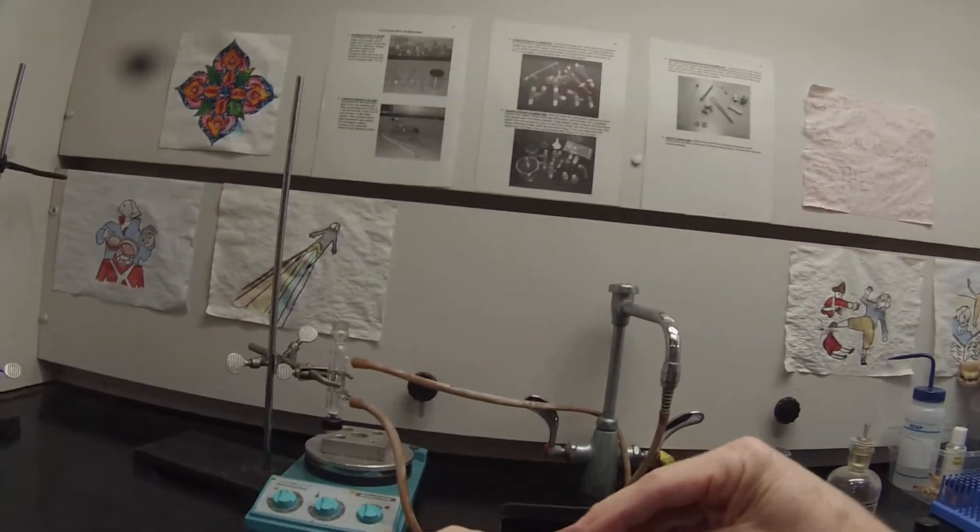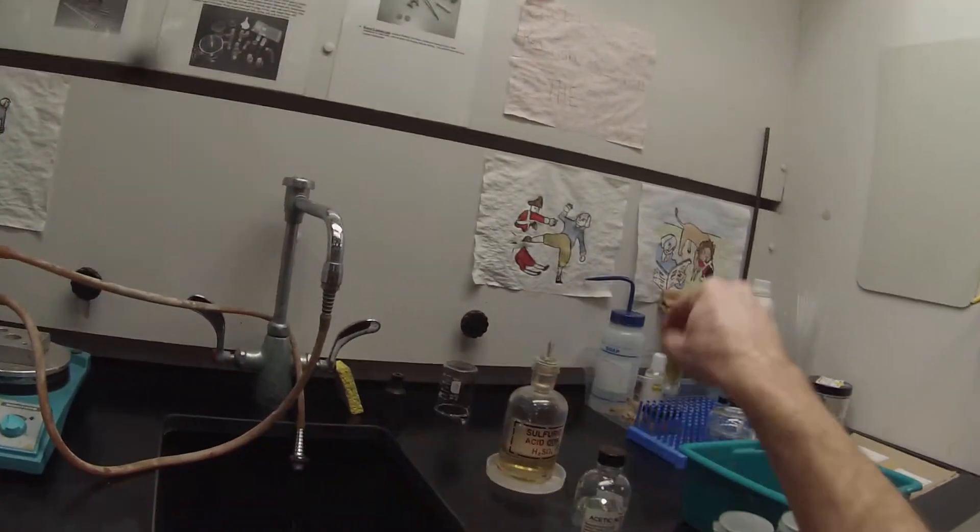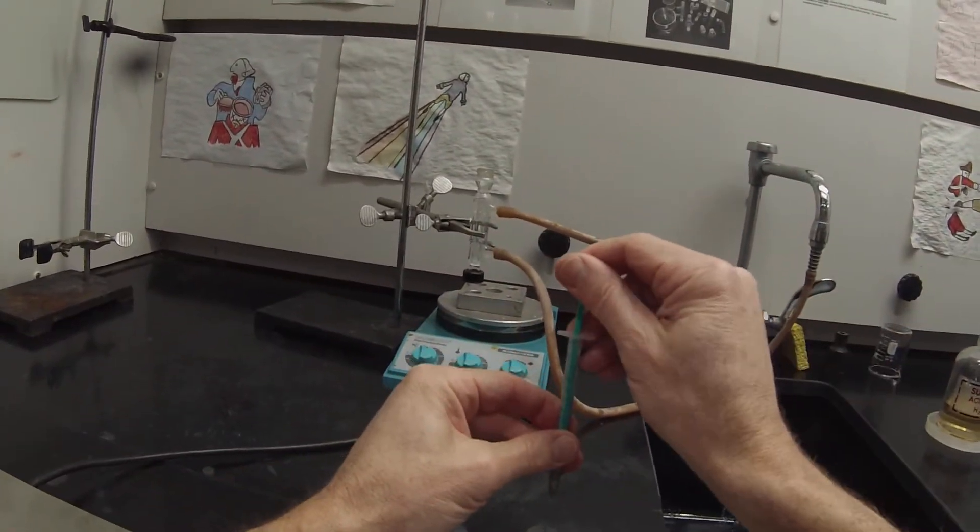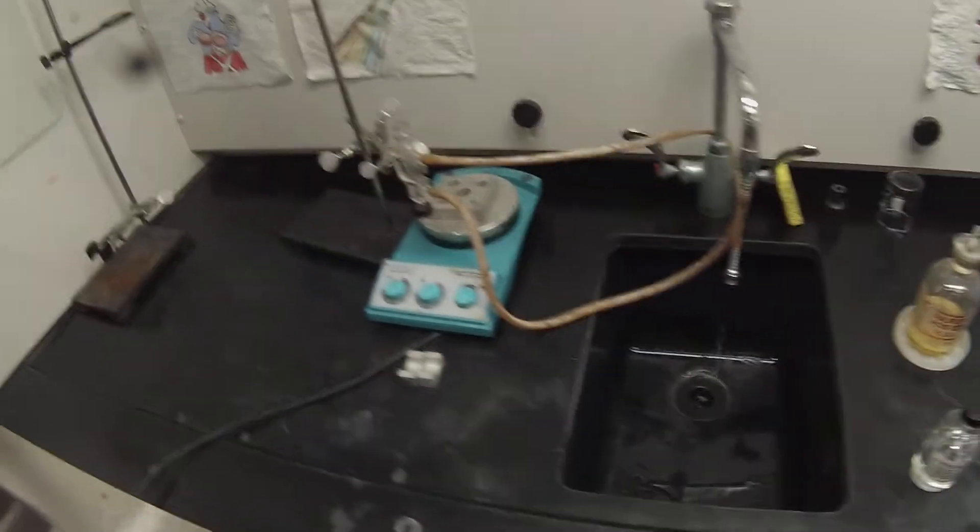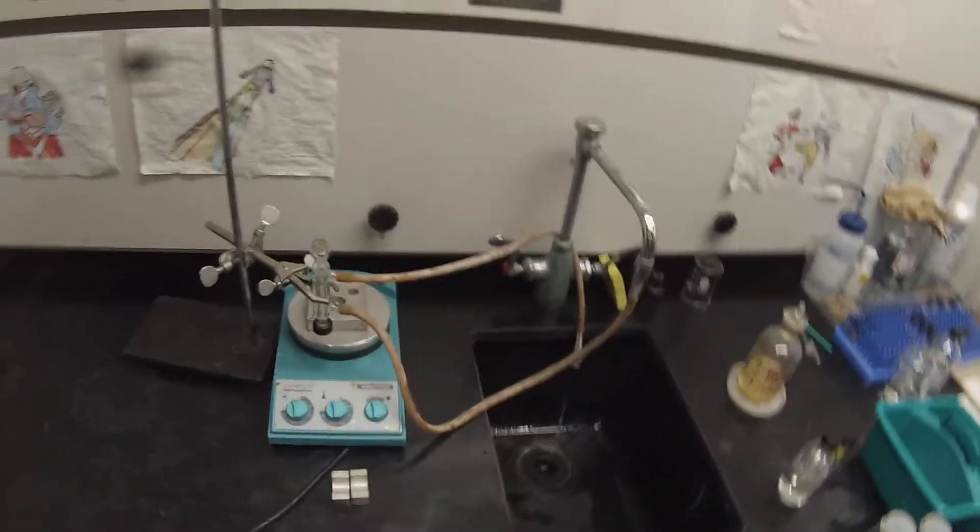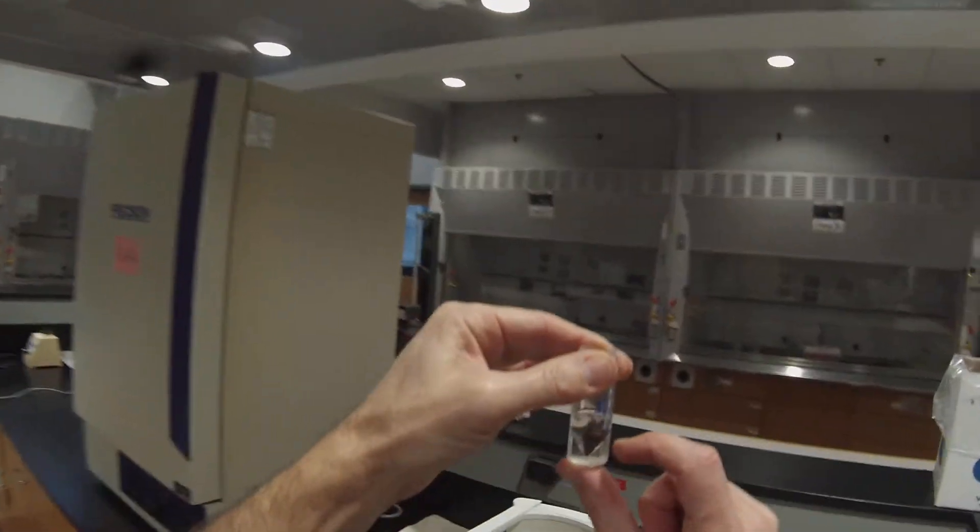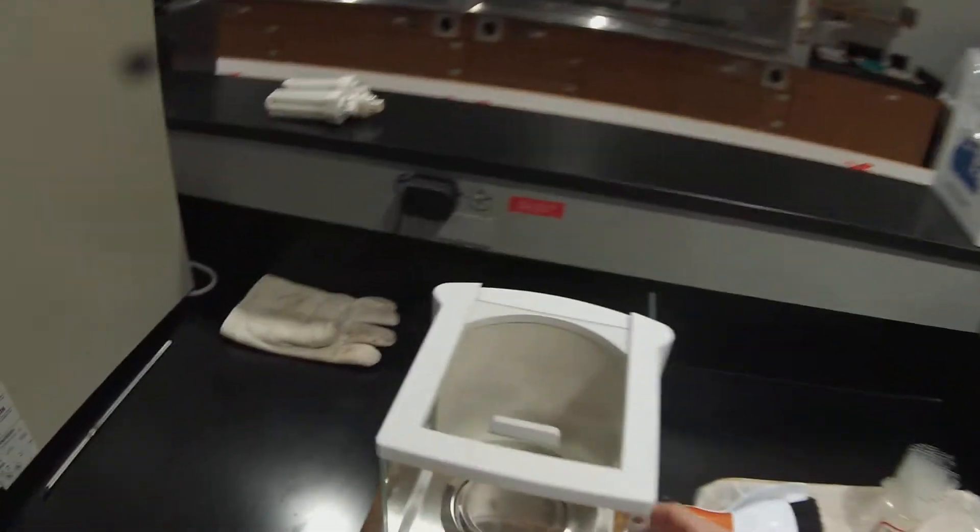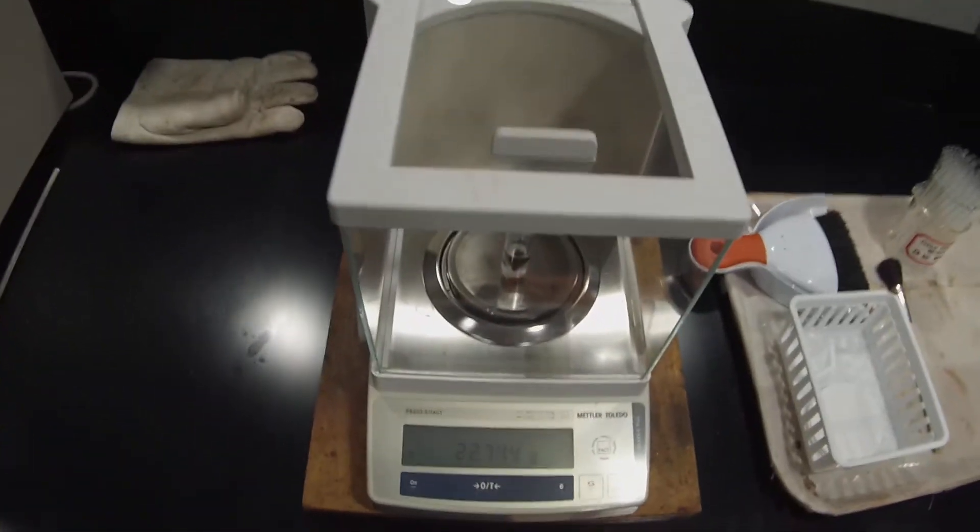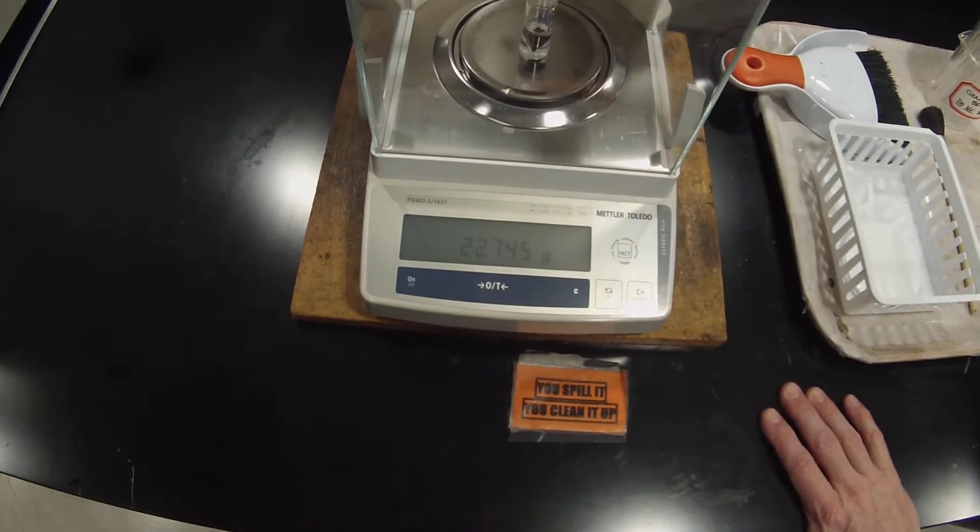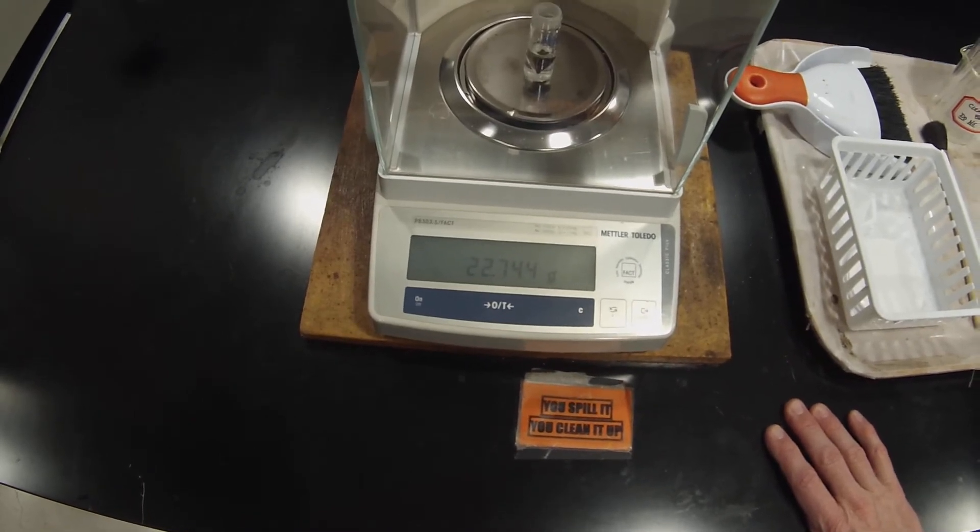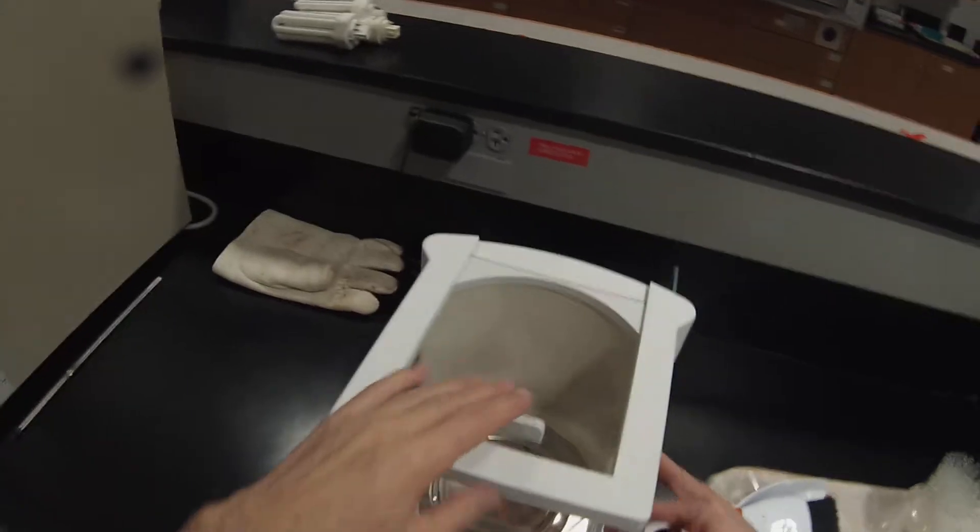And we'll cap that up. We don't want to spill the rest of our alcohol. And that can be disassembled. These alcohols are fairly volatile, so I'll just disassemble that and let it dry over the weekend. And we'll go get a mass of our alcohol. Looks like it's about 2 milliliters, so the spin vane is taking up at about 0.25 milliliters of volume. And it looks like we're now stabilizing at about 22.744 grams. So you can get the mass of the alcohol added by difference.